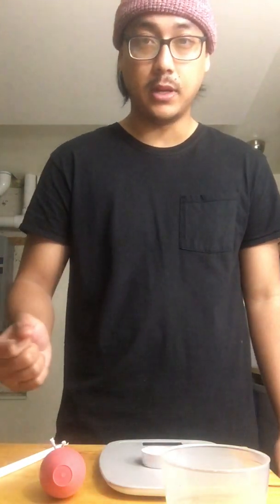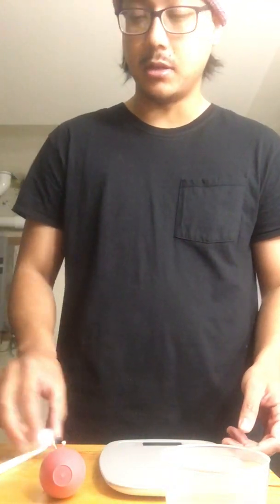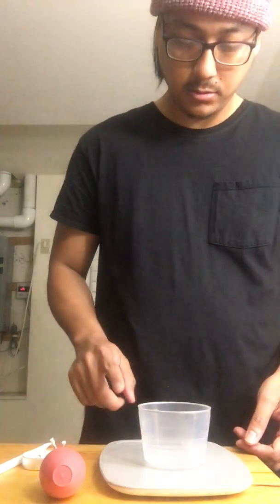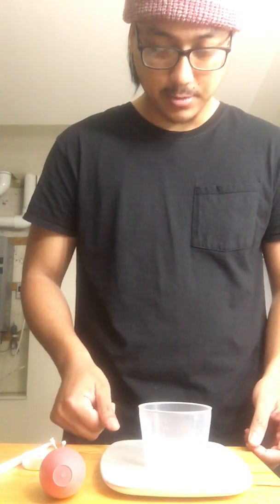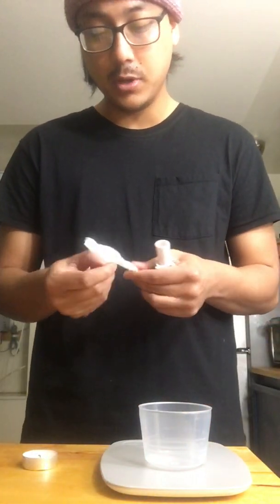Typically you're supposed to do this every day when you come into a lab so that the instruments are ready for the day, but we're at home in quarantine, so whatever — it works. The scale is calibrated. Now place your weigh boat on top and tare it so it should read zero. My scale is kind of weird and doesn't always do that — you get what you pay for on Amazon. Alright, next up, open up the straw.